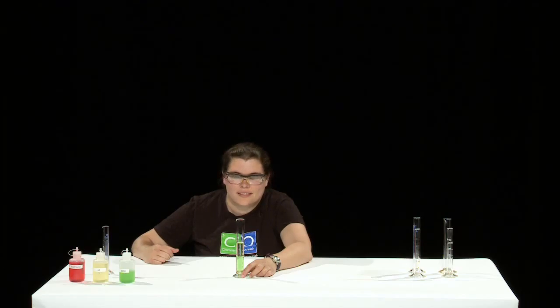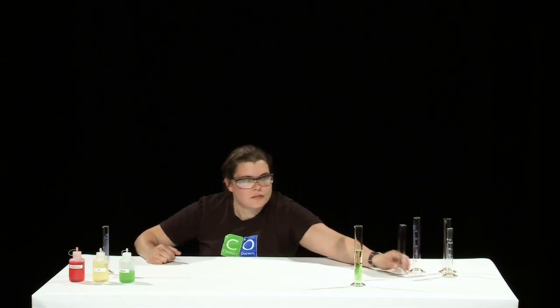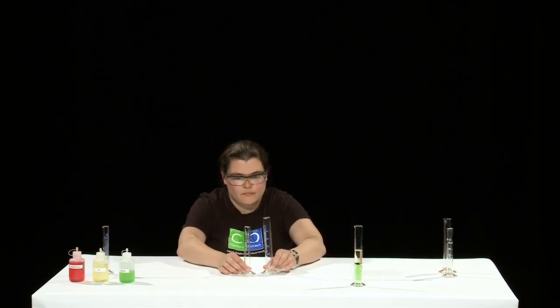Now it's important in science to do repeat experiments. This ensures that the answer you get isn't due to a mistake or an error. Trudy will now repeat this experiment twice more.